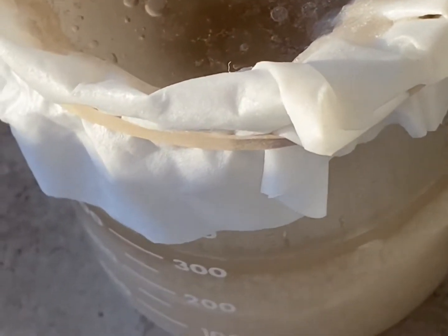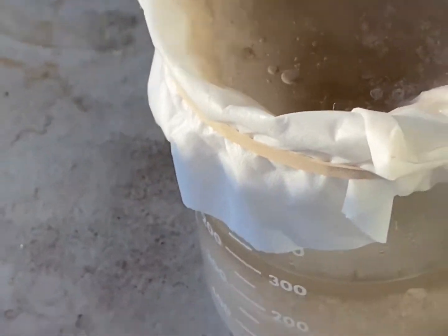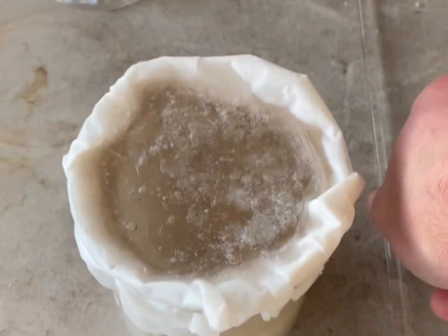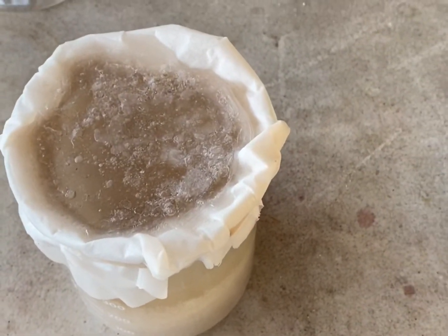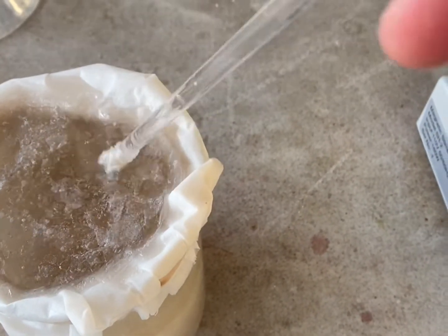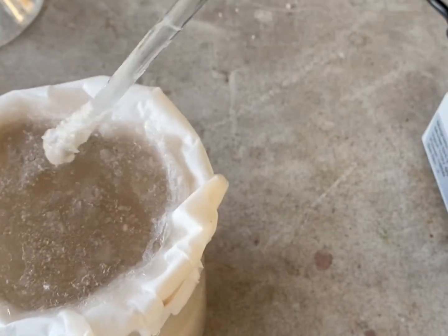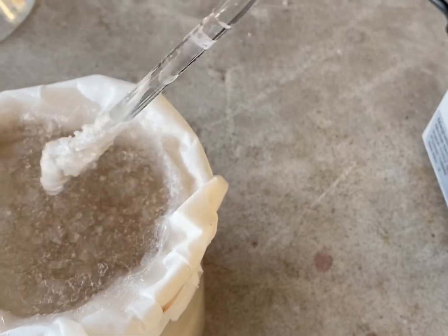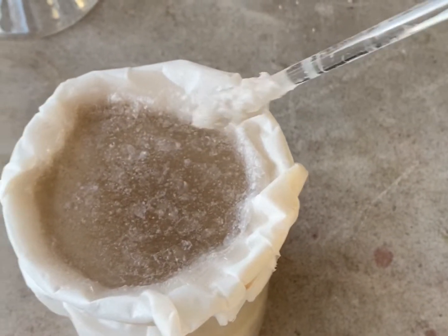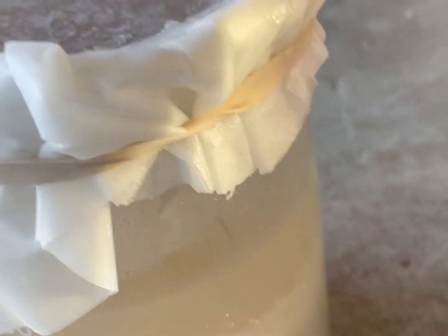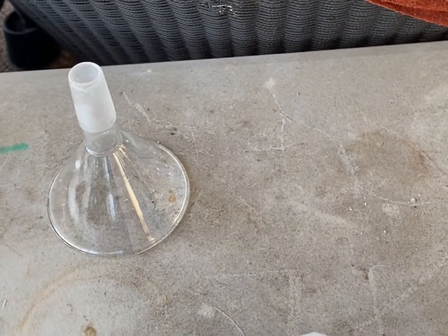And I just see there's a bunch of gunk at the top over here. So, once it's done filtering, I'll show you the end product. Gravity filtration is definitely not the most efficient method. If you look, there's like some crystallization happening on the filter, which is making filtration very slow. And as you can see, the stir rod's acting as kind of like a seed for a lot of the crystals. So, if you were to do this, I'd say use a vacuum filtration if you could.